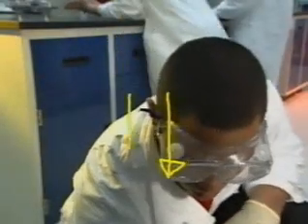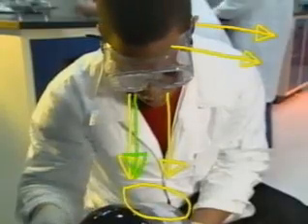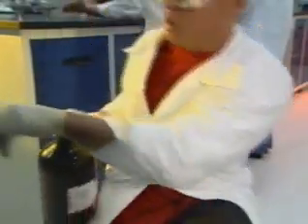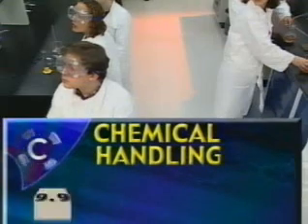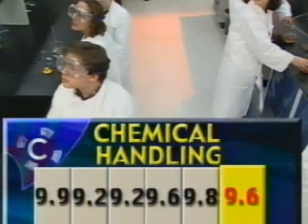Let's look at that again from another angle. He reads the label, and then he reads it again. And hey, it is a flammable chemical, so he's wearing gloves. That's just good execution. That's the way it's supposed to be done. What do the judges think about the chemical handling techniques here? Should be a good score. It is a 9.6. I can't see where they lost the 4/10, but hey, who understands these guys sometimes?